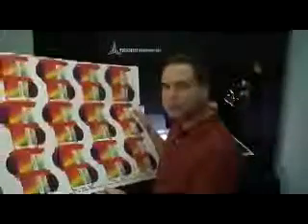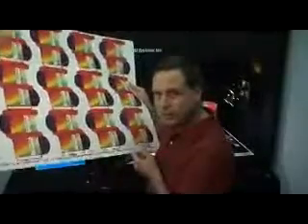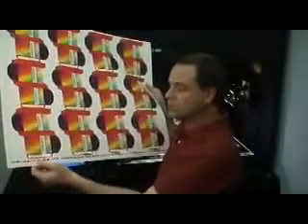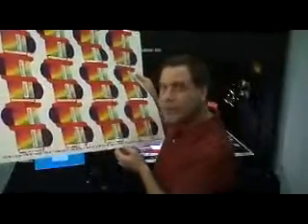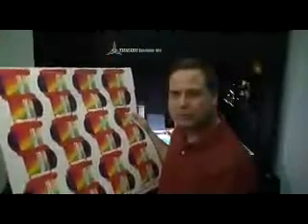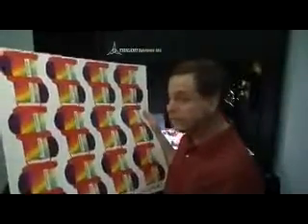Or a printer also can use the color bars located at the bottom of a print, or on the edges of packaging. You'll find these. And that's where the printer can analyze these color bars, and infer or assume based on these color bars if this final print is in or out of specification. Okay, indirectly.